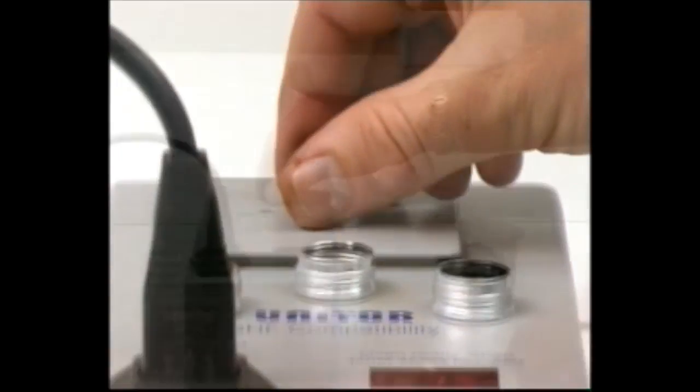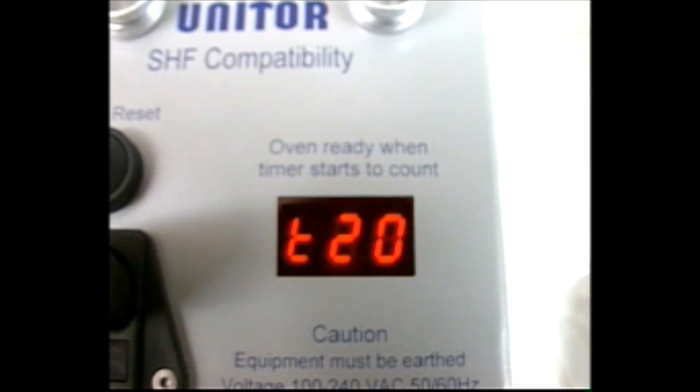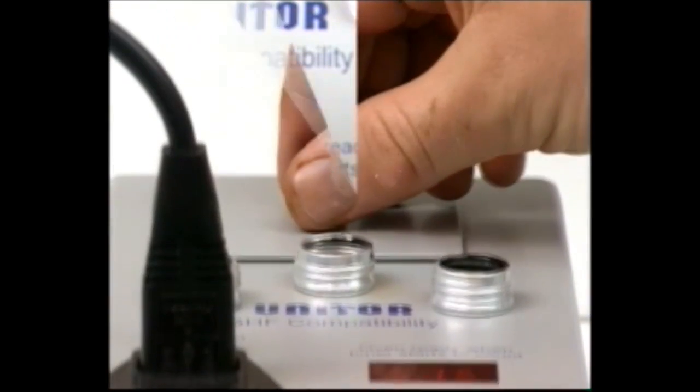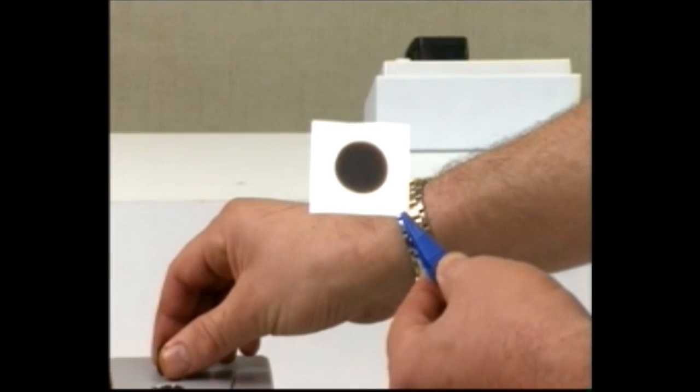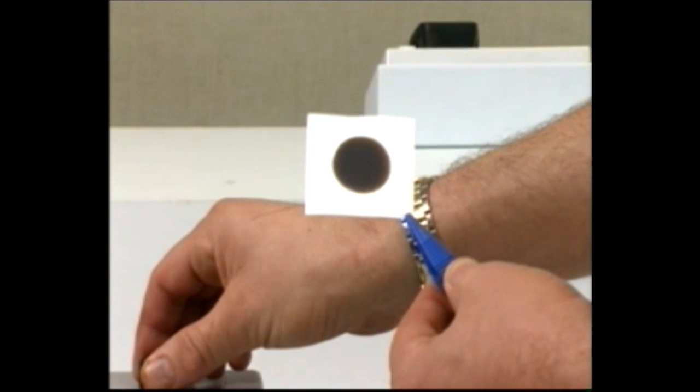Place the paper or papers in the oven. Press reset and wait for 20 minutes. Remove the paper and compare it against the spot rating chart. Ignore all other characteristics of the spot except the center ring.